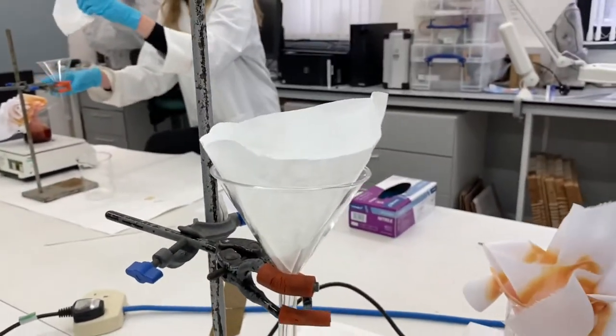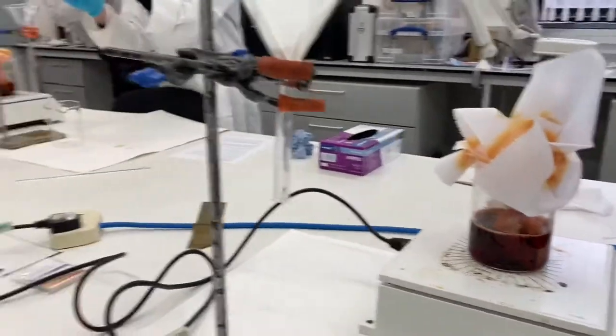We will then need to filter the hot solution so we build an apparatus here so that it can go through a filter into a new beaker.